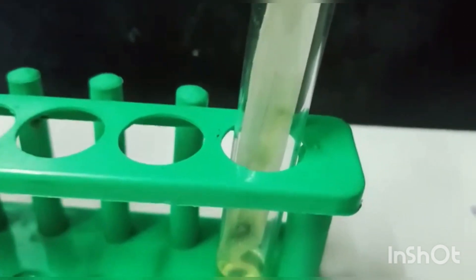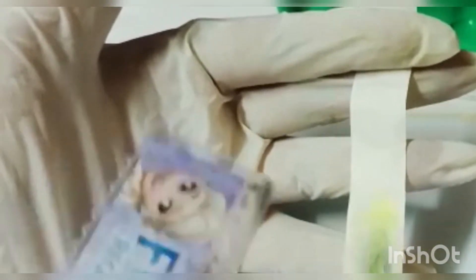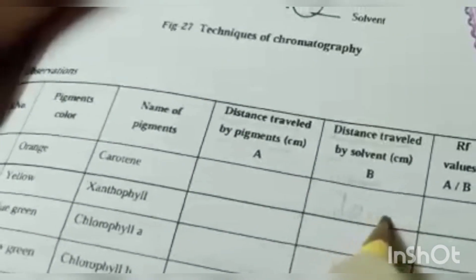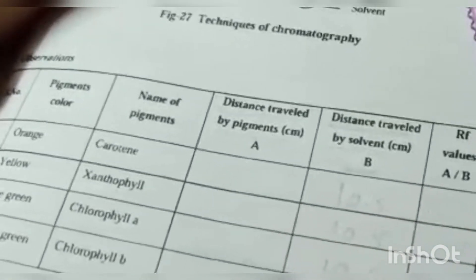Now the distance traveled by the solvent is visible here — you can see the solvent front. I will remove this strip and show you the different colors of the pigments. Here is the strip; we mark the distance traveled by the solvent. Using a scale, measuring from the point of loading to the solvent front, it is about 10.5 centimeters. You will mark this as 'B', the distance traveled by the solvent, and record 10.5 in all columns.